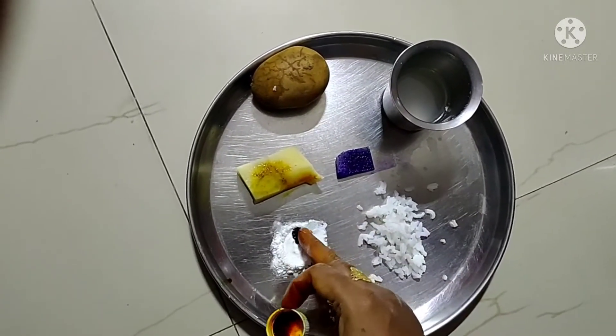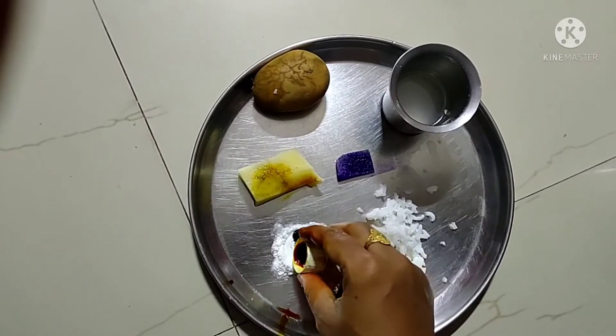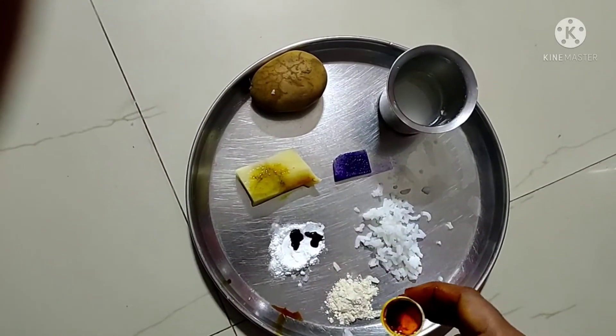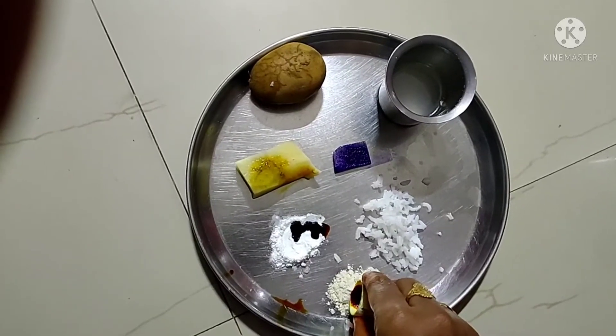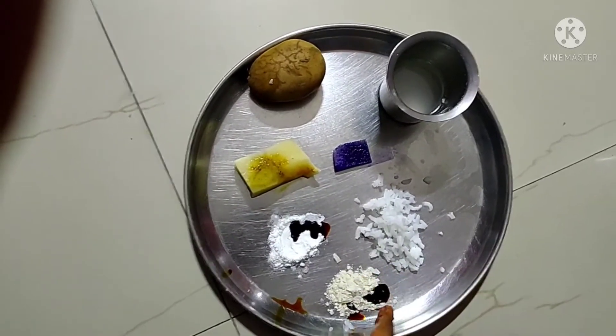Immediately, the rice flour turns into a blue color — see this change! And this one is wheat flour. Wheat flour will also change its color to blue, just like this — see.